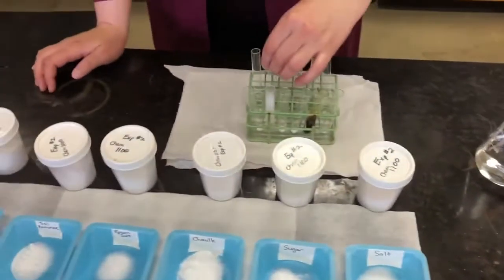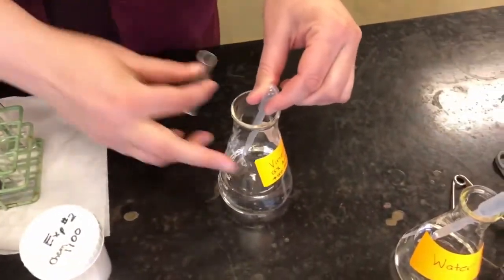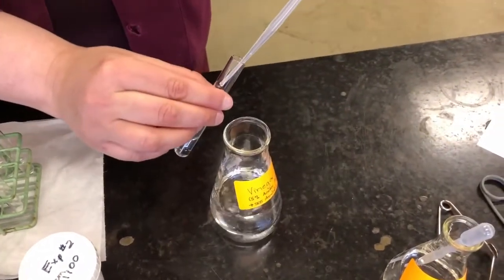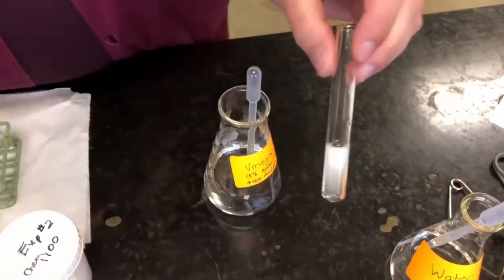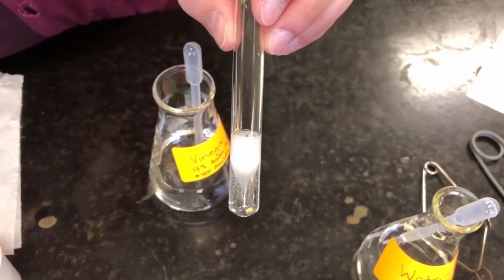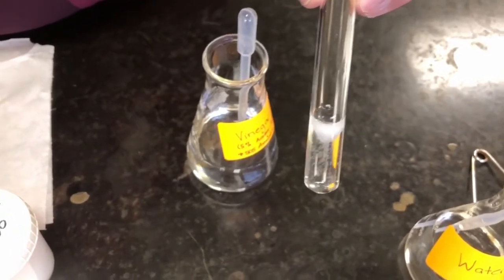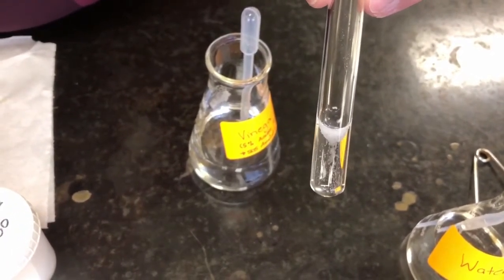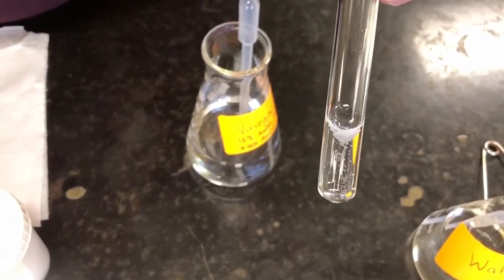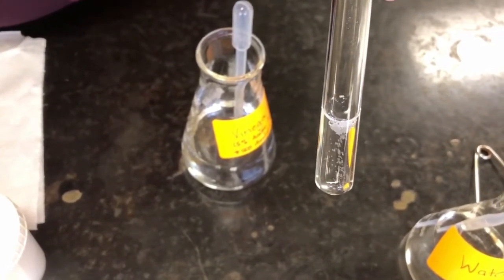And finally, we will take our washing soda and we'll add vinegar to it. And look at that. Right away, you see it's fizzy. Kind of looks like a carbonated drink. And that's the bubbles being produced from the reaction with the washing soda and the vinegar. You might be able to hear a little bit of fizziness too. So that's a reaction. So production of bubbles means a gas has been formed.